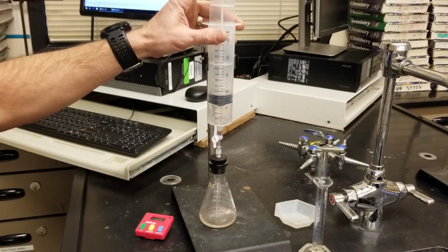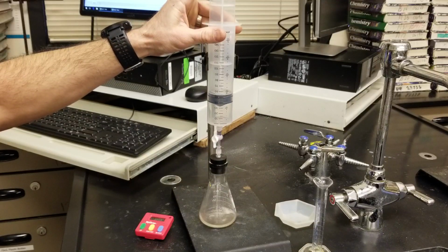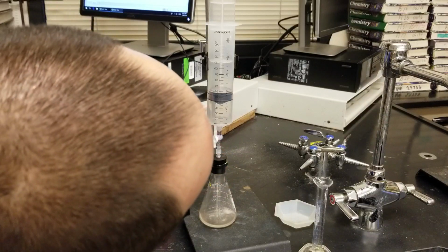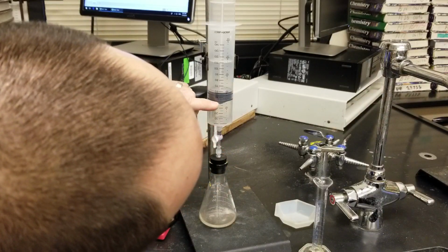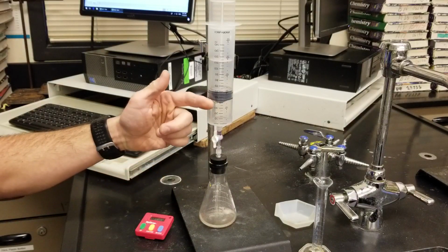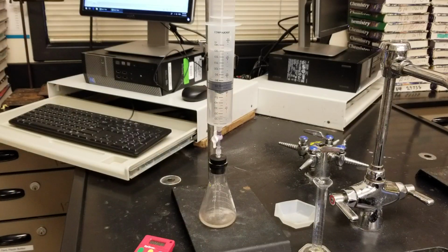Now I'm at 1 minute, where you'll take your plunger, push it down, make sure that the plunger is moving, and then wherever it stops, it looks like I'm at 42 milliliters. And that's only 2 sig figs because we don't have much precision with these syringes.